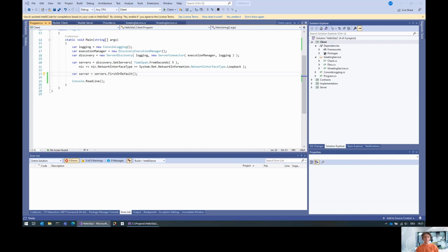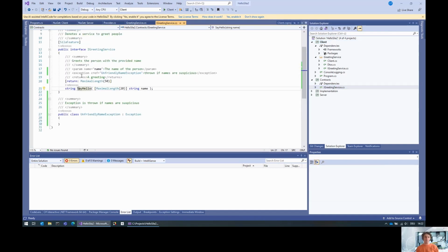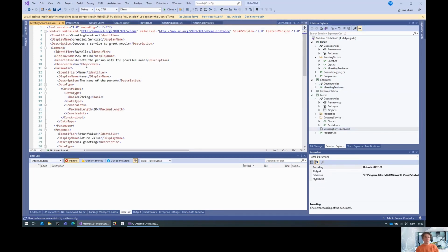In this short video, I'm going to demonstrate how to use the dynamic client that the Tecan SiLA 2 SDK provides. For this, I already started a server that again has only the very default greeting service, so just one command with the name say hello. You can take a look at the feature description: one command called say hello, in the greeting service.